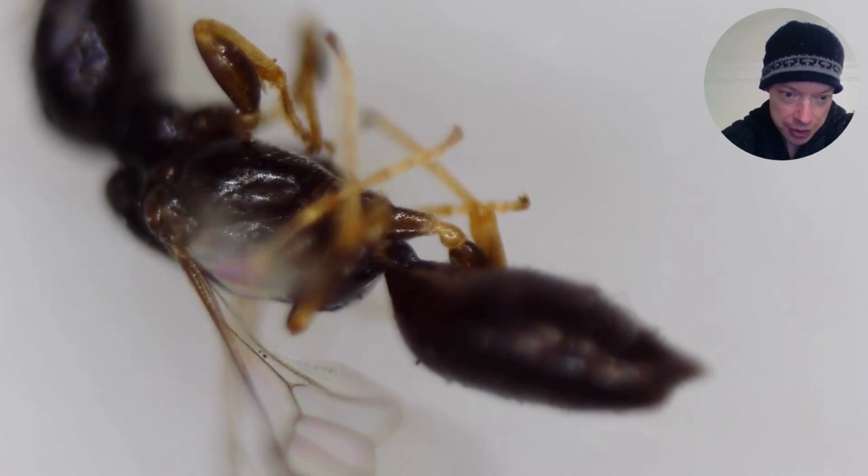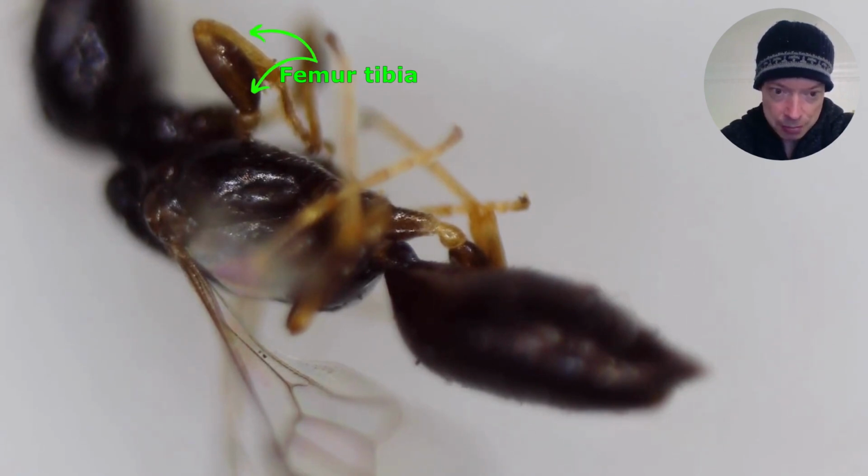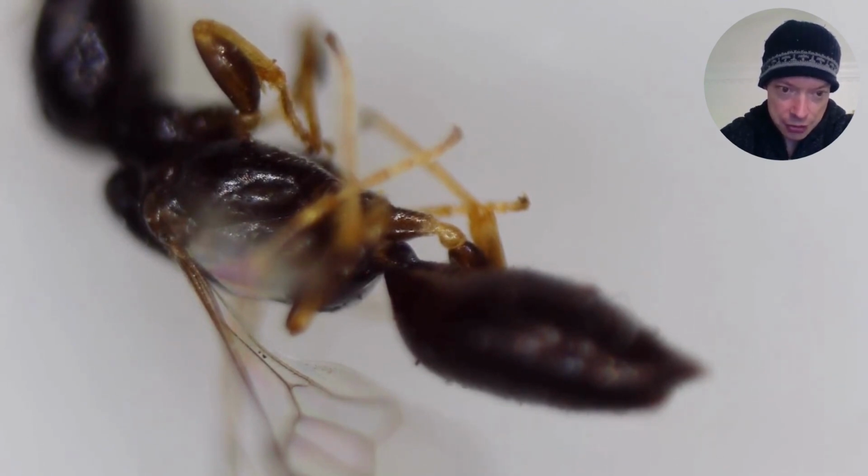On the back leg, we can see the coxa, which is the leg segment closest to the body. After that, we have a small leg segment that's like a little ball. That's called the trochanter. If you look on the front leg near the head, we can see a leg segment that's more or less horizontally oriented. That's called the femur. And the leg segment before the tarsus, sticking out with a vertical orientation, is called the tibia.